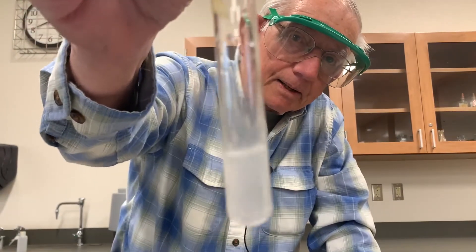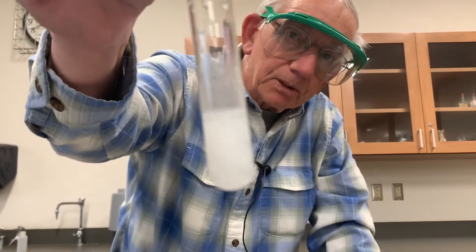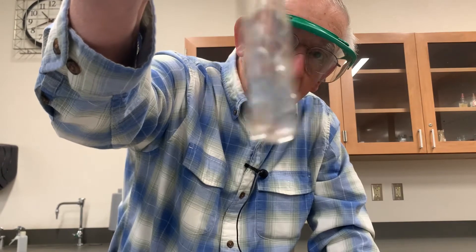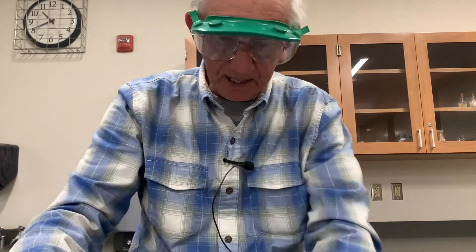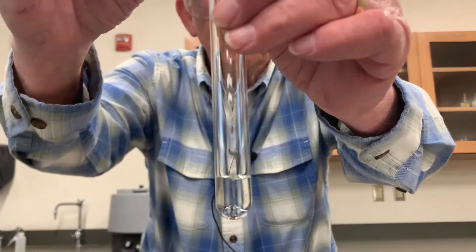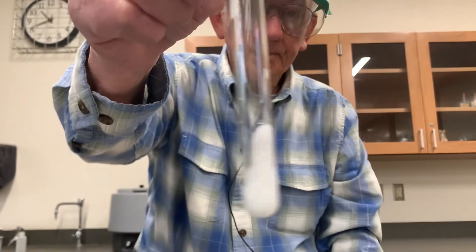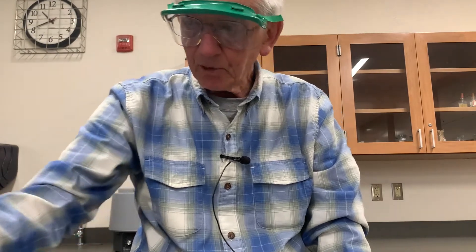Look at that — it didn't form right away, but clearly something's going on in there. Once again here's our calcium — nothing slowly forming there. Finally, barium with sulfate. One of the things you're seeing is that barium seems to react with lots of stuff. That's typical of heavy cations, and barium is well down toward the bottom of the table.